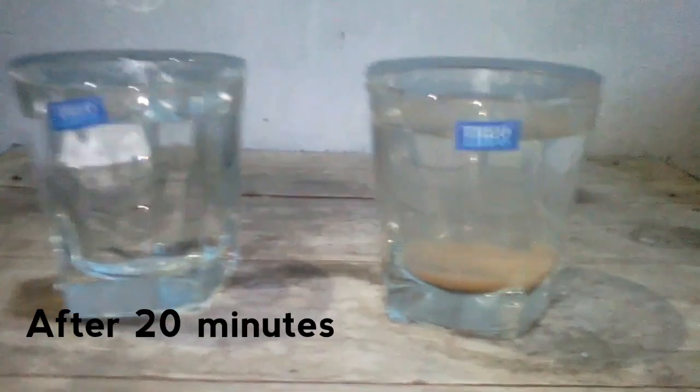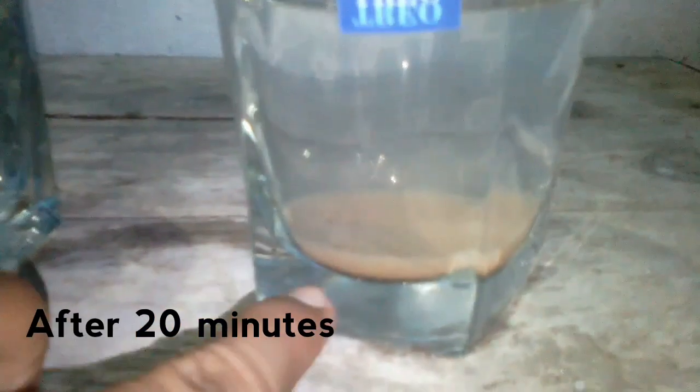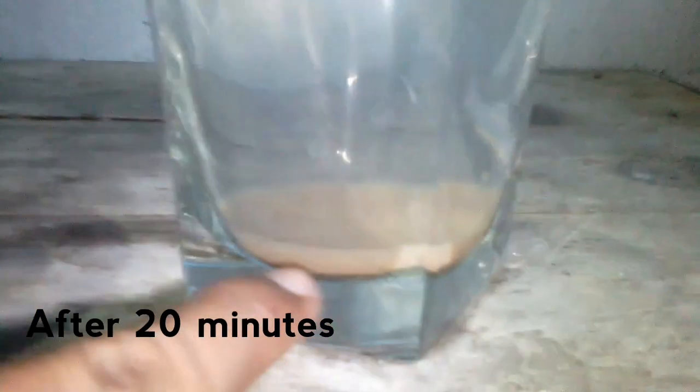This is the coagulation process. In coagulation, the alum causes the colloidal particles to clump together into a mass, increasing their density so they settle down under gravitational force and form a floc. You can see the floc here.